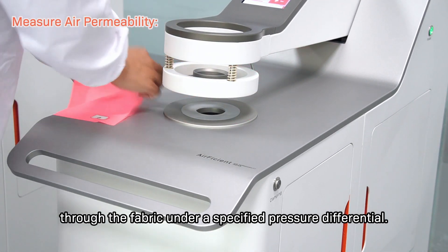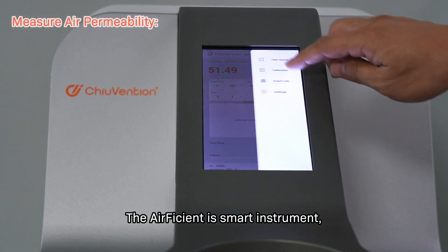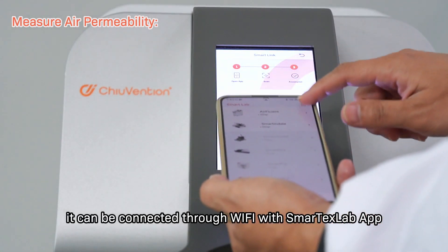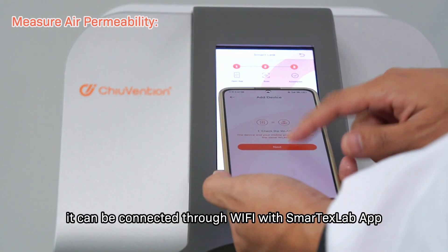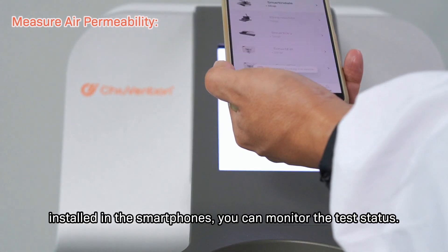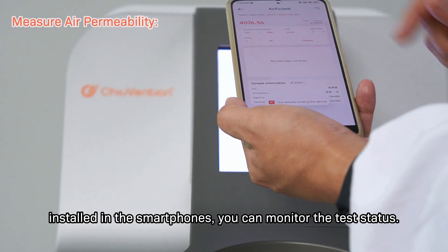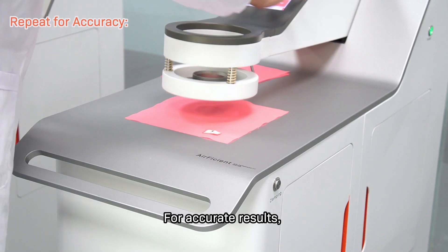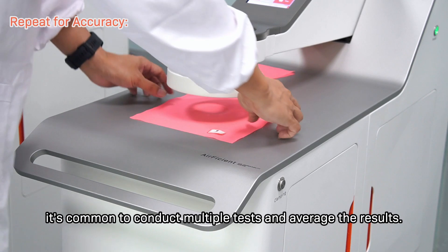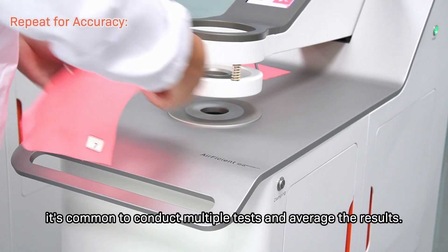The air permeability tester is a smart instrument — it can be connected via Wi-Fi with the Smartex Lab app installed on smartphones. You can monitor the test status for accurate results. It is common to conduct multiple tests and average the results.